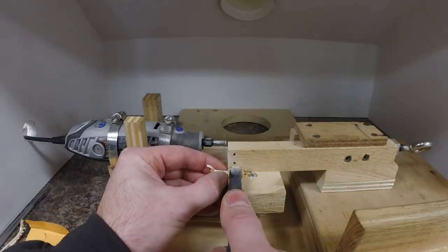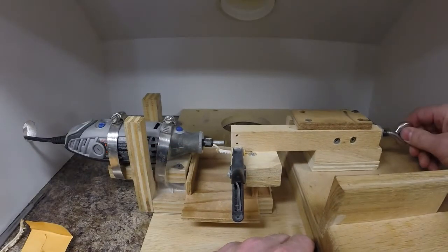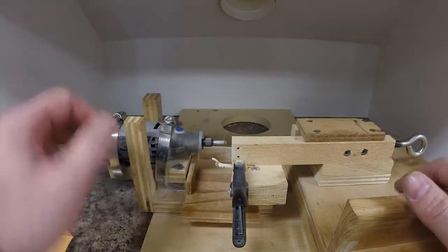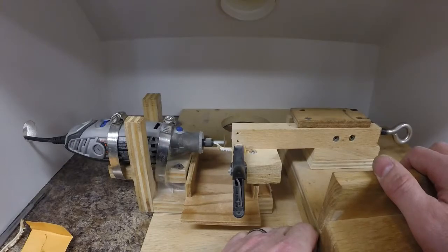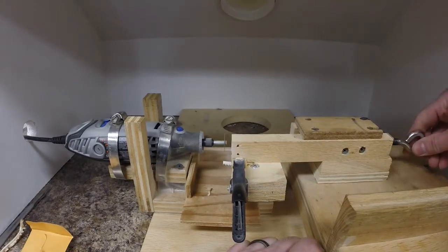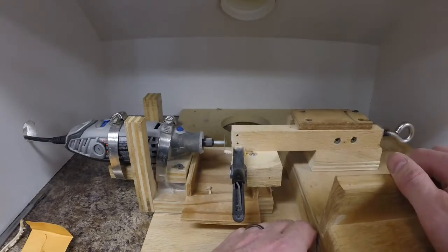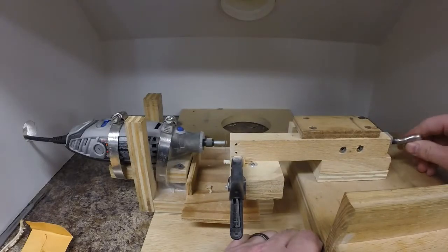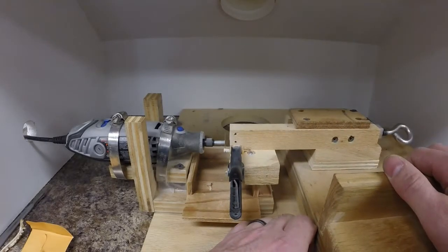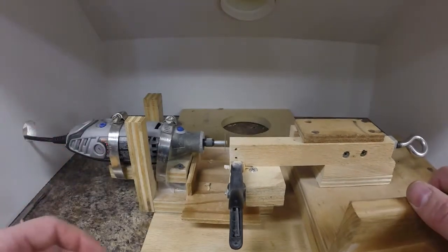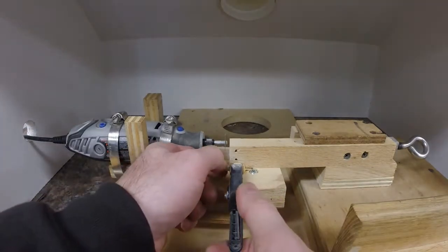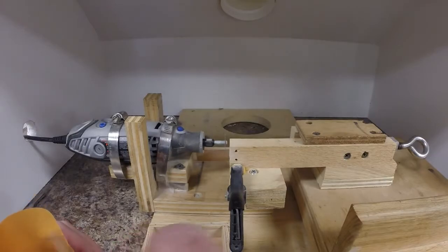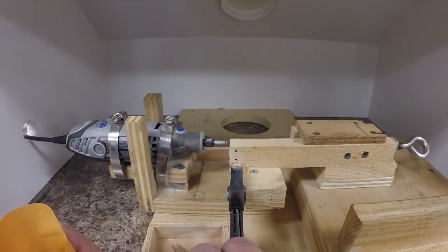So set another one perpendicular to the blade, set the first cut, turn on the dust collector. First cut, half a turn, three quarters. Most of the time it ends up being the center one that I use, the five eighths or so, but from fish to fish that varies.